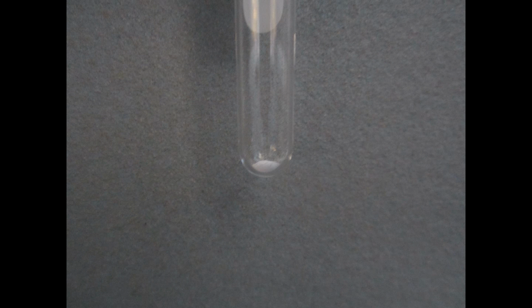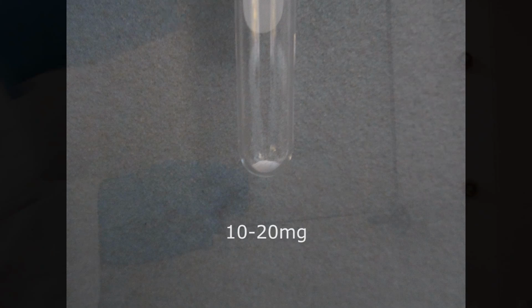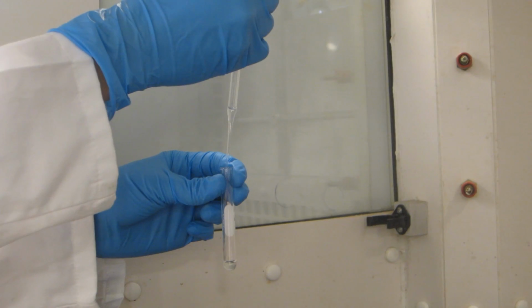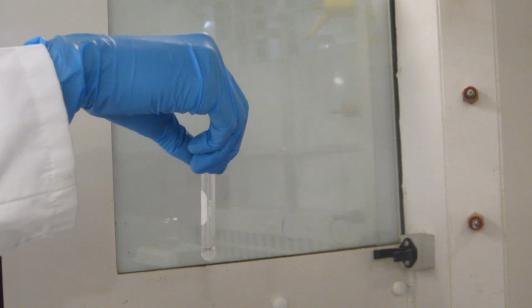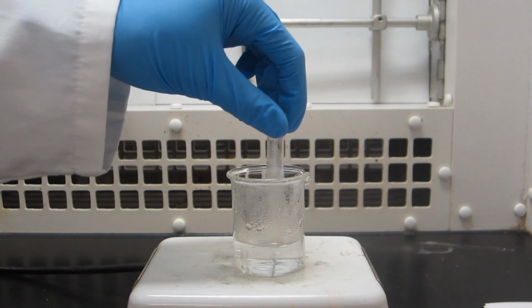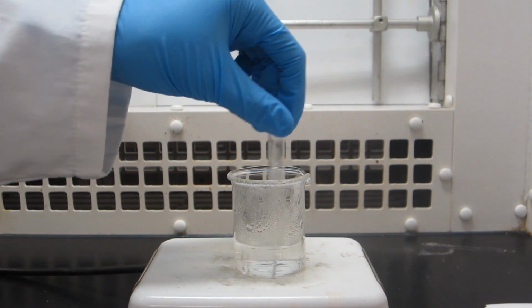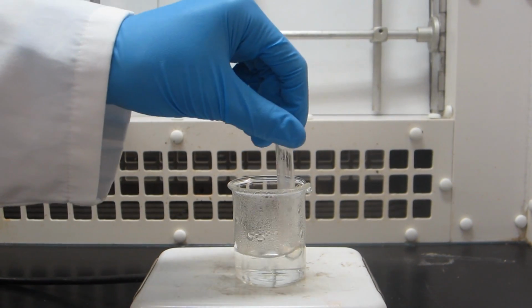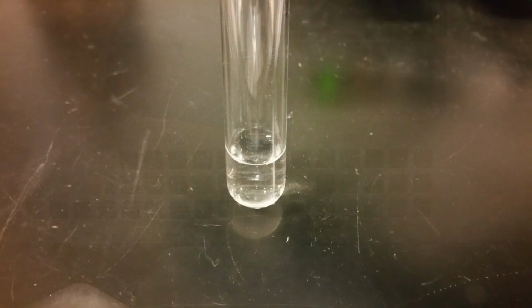To begin exploring potential solvents, place approximately 10 to 20 milligrams of the impure solid in a test tube. Add about 0.5 milliliters of solvent to the tube and swirl. If the solid dissolves at room temperature, this solvent is not appropriate for recrystallization. If the solid does not dissolve, check if it dissolves at a higher temperature by heating the solution to a gentle boil for about 1 to 2 minutes. If the solid dissolves, this solvent is likely appropriate for a recrystallization.